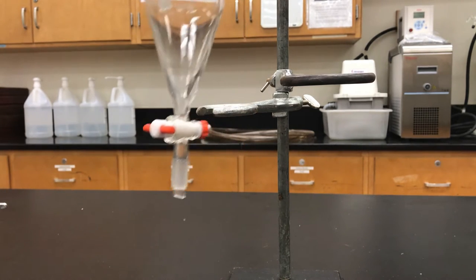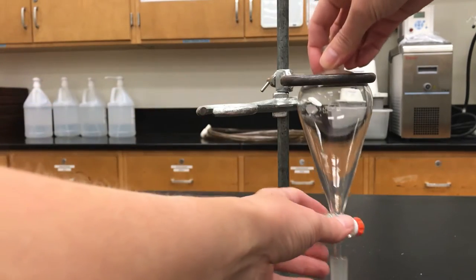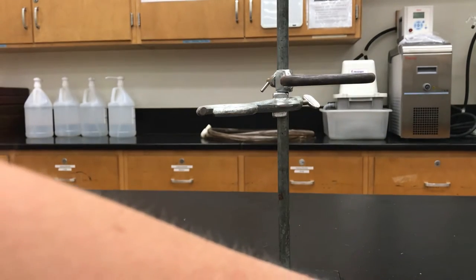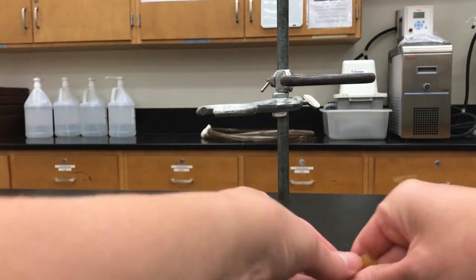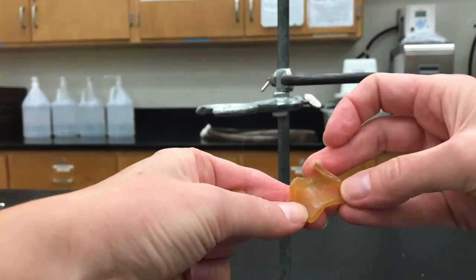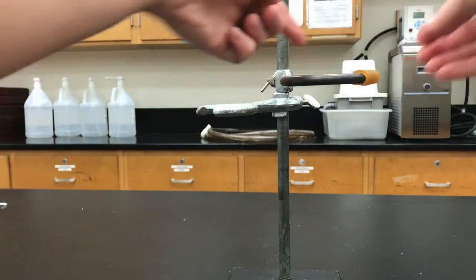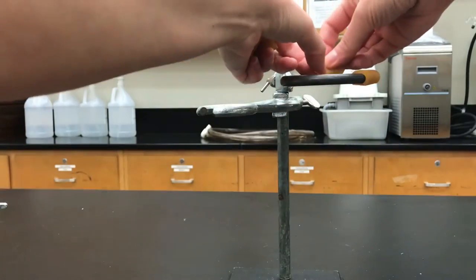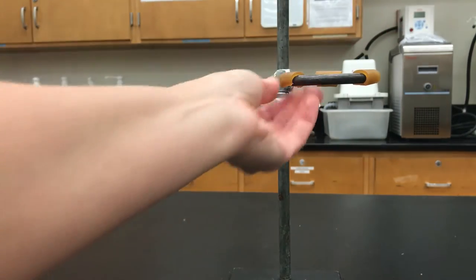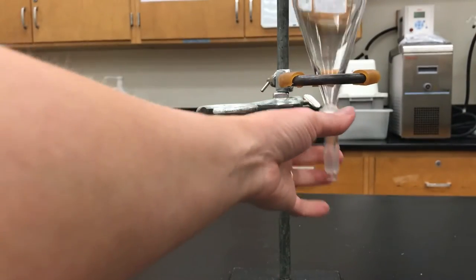The completely circular ring clamps can work too, but the problem is if it's too big it won't actually hold. To fix that, if you have little pieces of slit rubber tubing you can put those around the clamp to make it a little smaller so it will hold the separatory funnel, and it also acts as a nice cushion so you're less likely to break the glass.